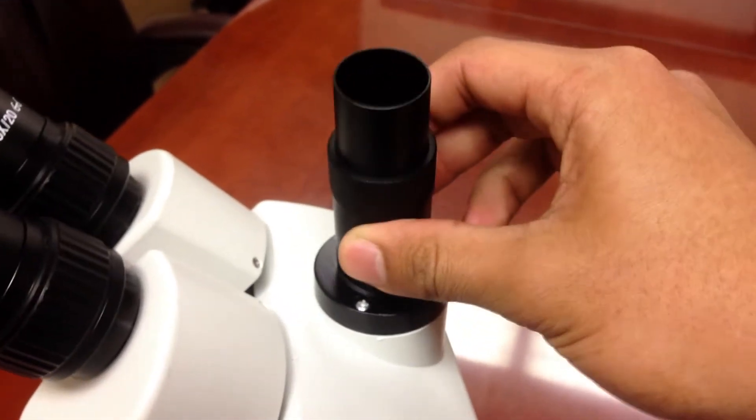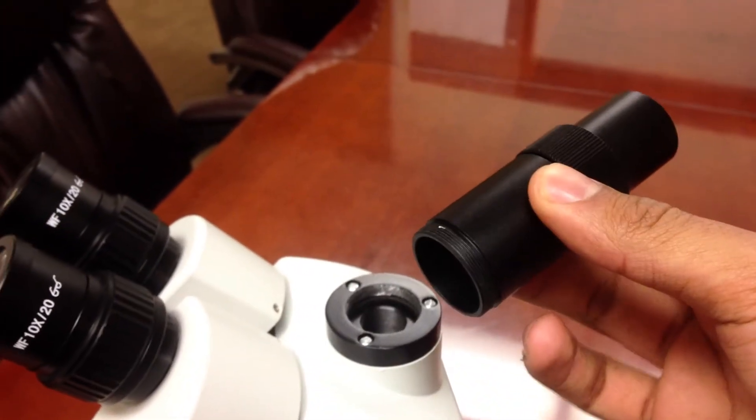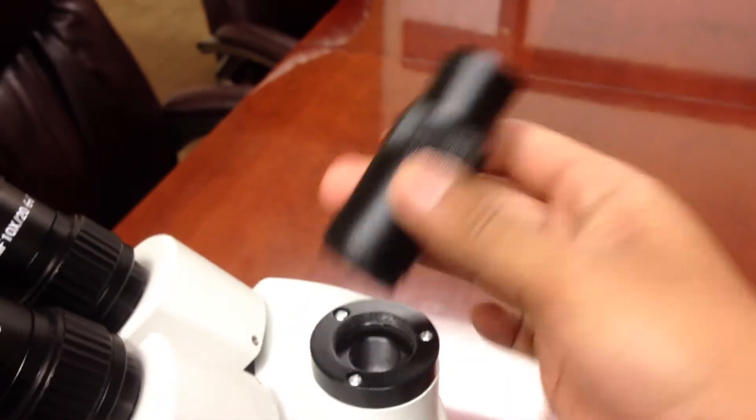This is the trinocular port. But for this video purposes, I already kind of unscrewed it, so it's loose right now. But basically, just unscrew that.